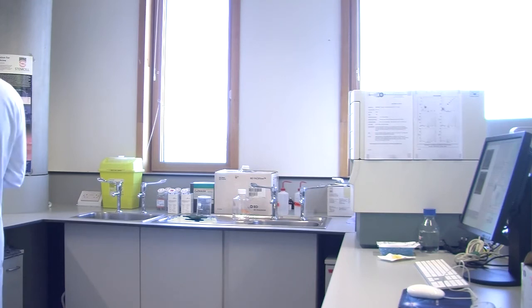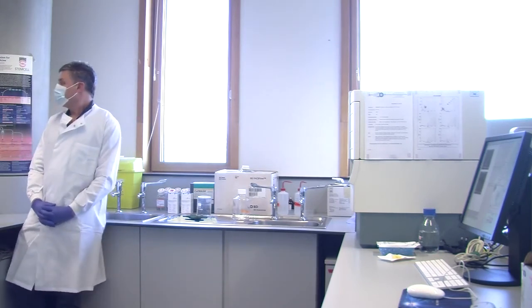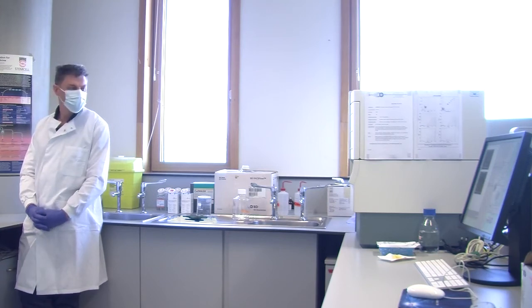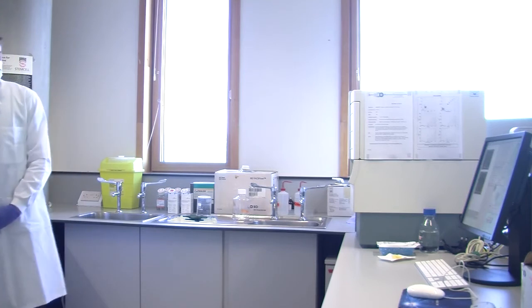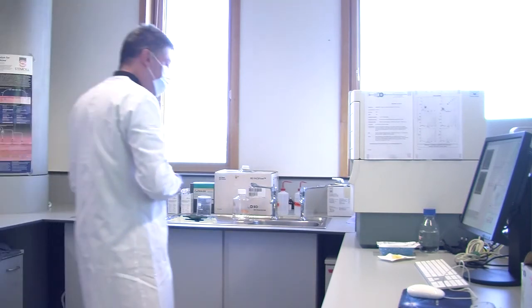So I have left on your bench... So the three on the front will do the antibodies. Sorry, give me a second. So we have Christy.